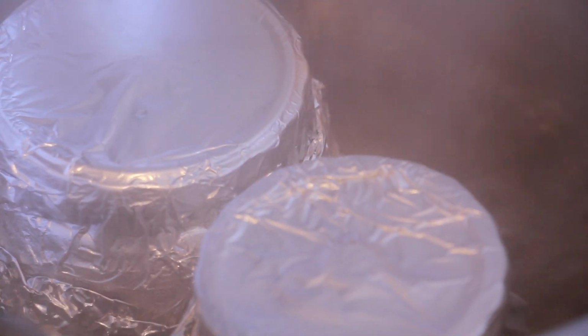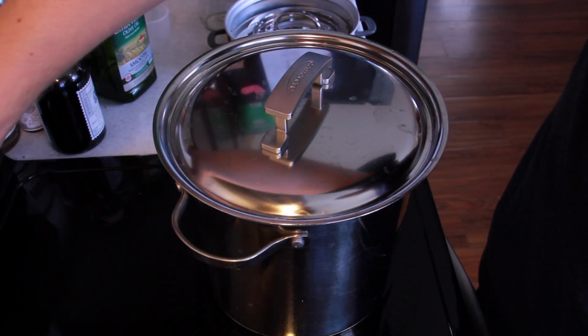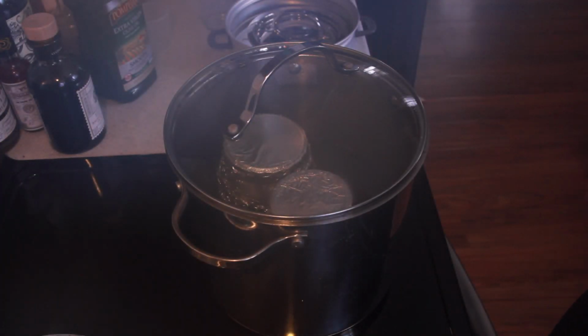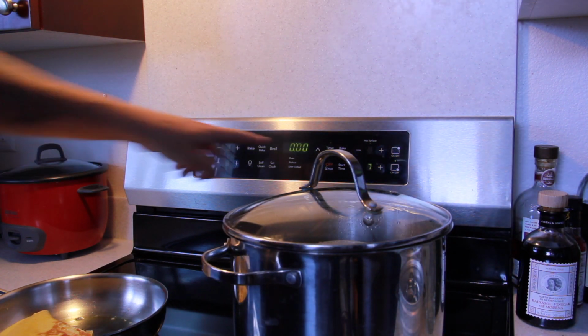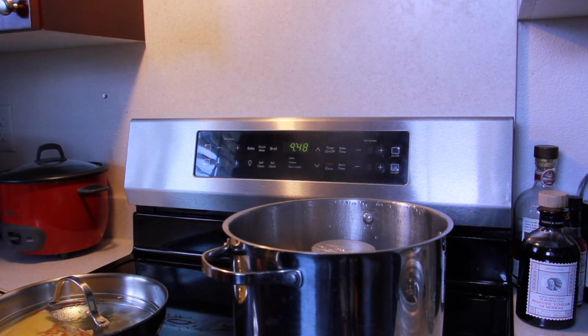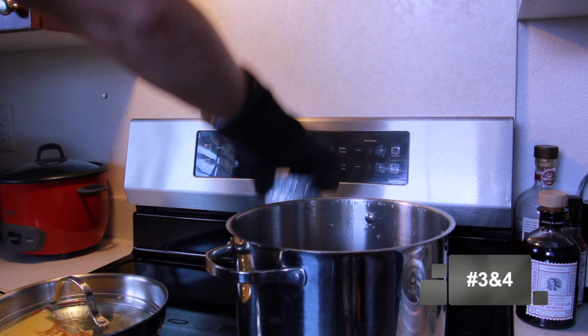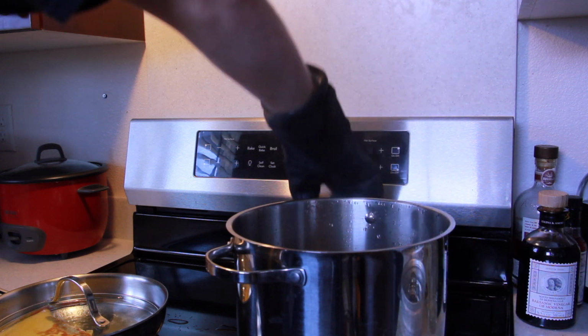I had a little bit of difficulty finding the right lid, so I threw this big fat lid on first and then eventually found the correct lid for the pot. So we can still see what's going on inside the pot while it boils. I'll let the jars boil for 30 minutes. Conveniently, this helped me get my breakfast done at the same time. Alright, so jars 3 and 4 are ready to go. I've just got to let them cool down and then later we can inoculate them.